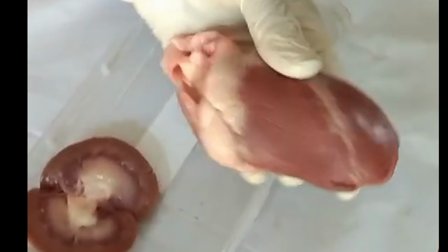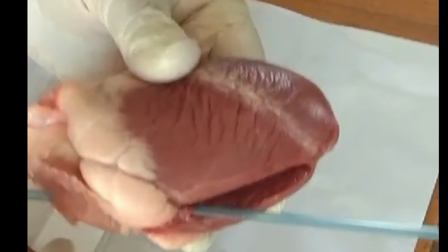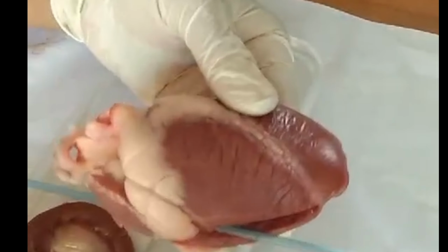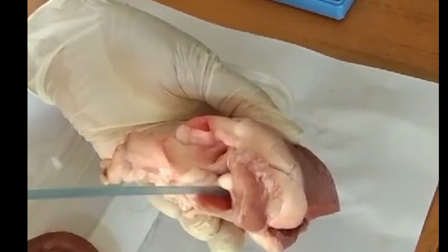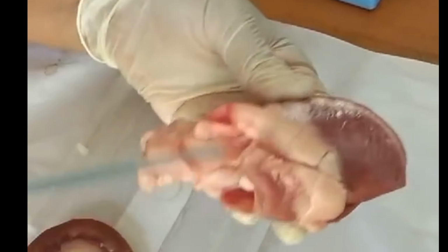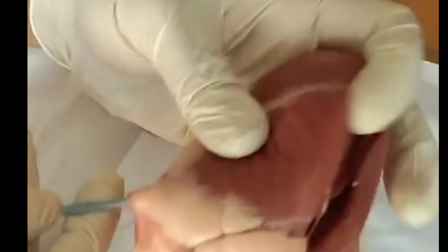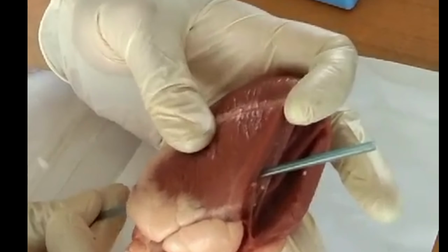So how can you decide what this vessel is? If I take a straw and insert it into any one of these vessels, depending upon where it is opening, which side it is. Right side. It is opening through the right auricle into the right ventricle. So this is a very big blood vessel, your superior vena cava. And when I put a straw into this one, it is opening into the right side. It is the pulmonary arteries.